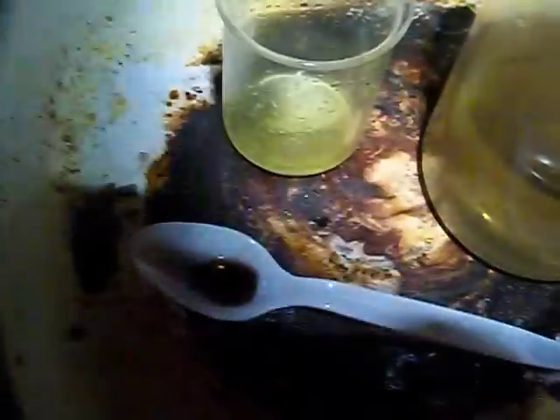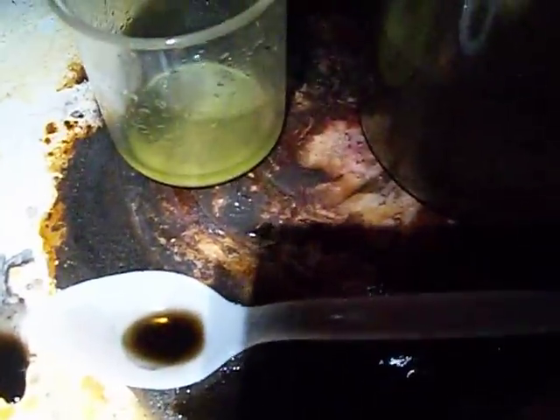It's got a lot of palladium out of the first one — it's cementing on copper right now. Palladium will follow gold, so this is the second refine and you can still see how much palladium is still in it — quite a bit. This one had the gold and palladium still in the same solution. That really black stuff right in the middle is metallic gold and metallic palladium that fell with the stannous chloride, but it's mixed with tin so it's got to be processed again. Every bit of this in the pan — the carbonized part, the black part, the purple part around the edges — the pan's purple.